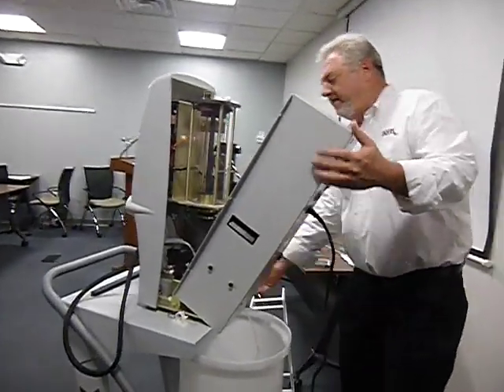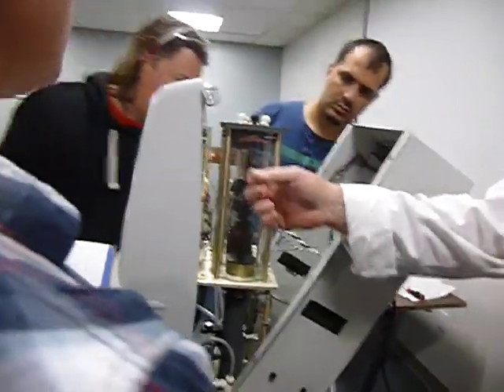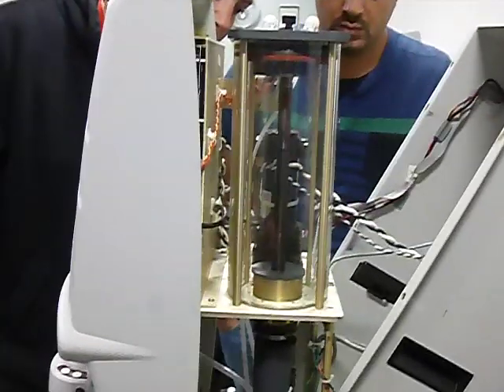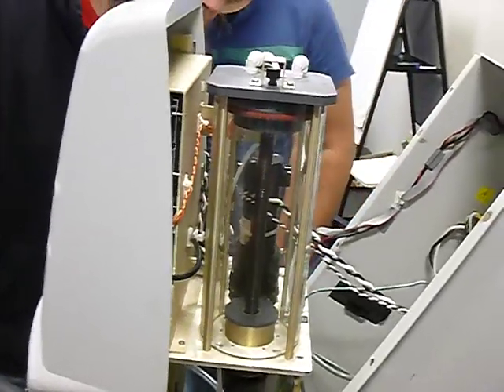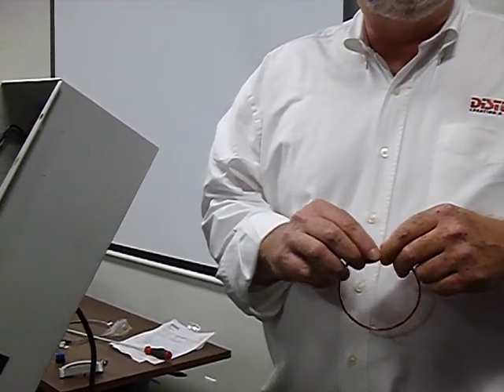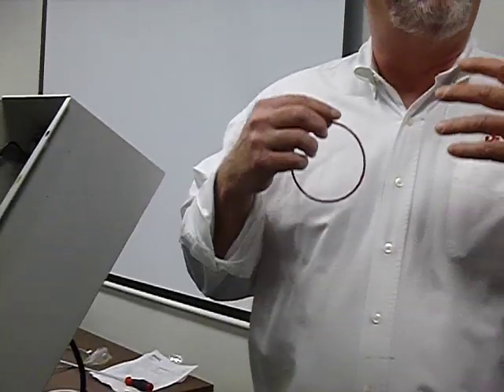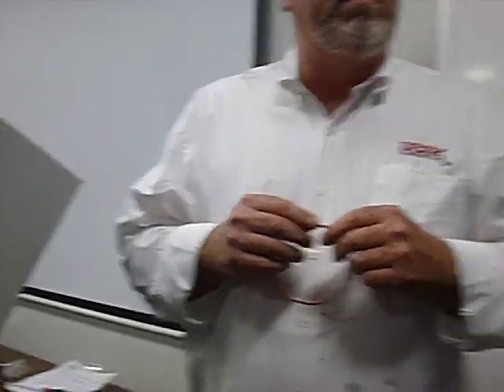So this is the inside. What we have here is the glass tube. You see right here is an O-ring. This O-ring should be changed out every 6 months. I have changed it only once, and I have 3 or 4 instruments. It depends on how much you use them. We have customers that use them day in and day out. I change it when the noisy sound appears.